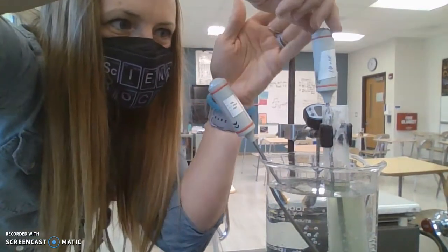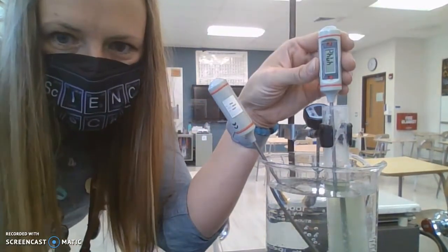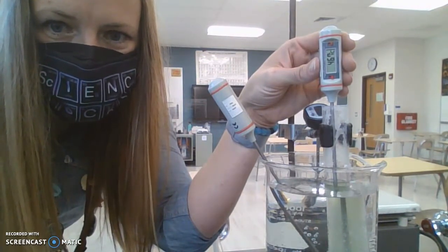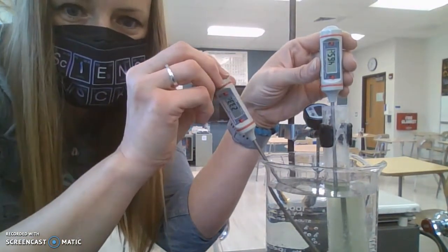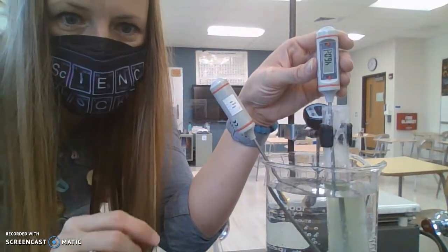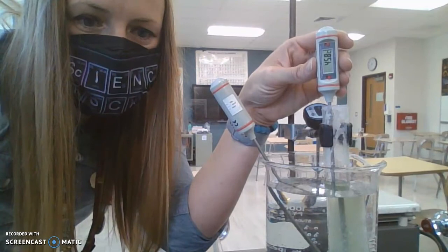So you can see that it is going down. Our temperature in here is 23. We'll see what happens.